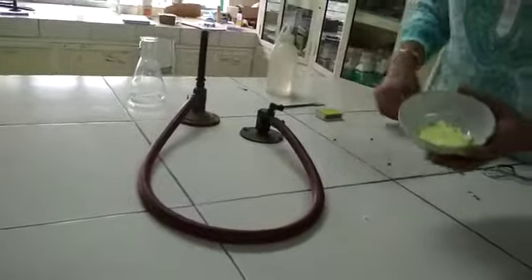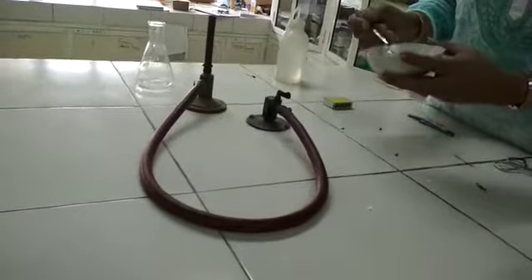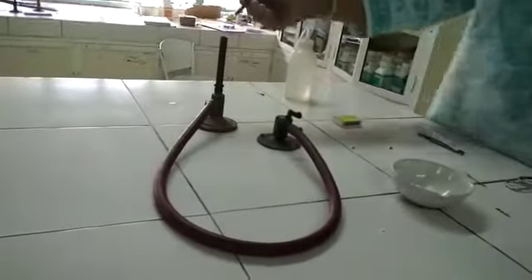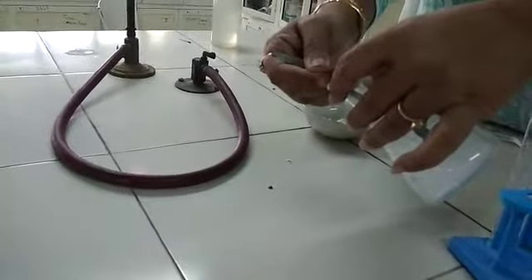Now let's prepare a non-metallic oxide. I have taken sulfur. I take a spatula and burn it. It produces a suffocating gas. I am collecting this gas — you can see a few white fumes coming out. This is sulfur dioxide, the gas which is produced on burning of sulfur.